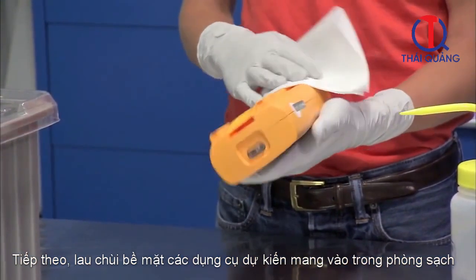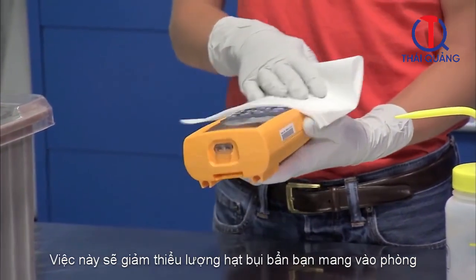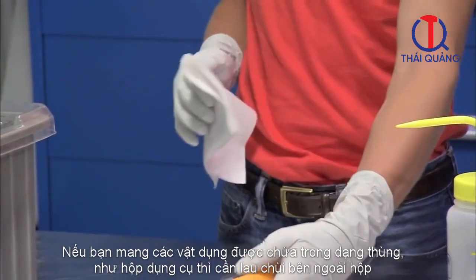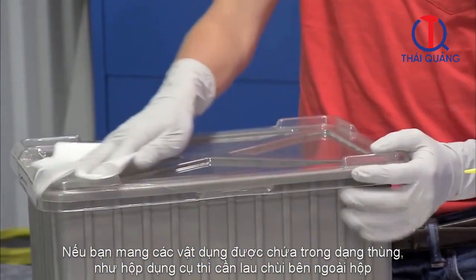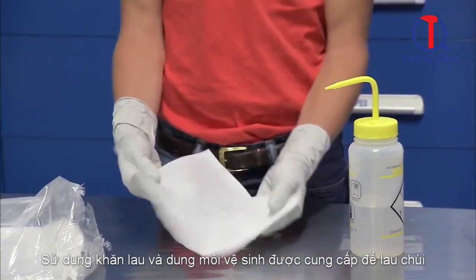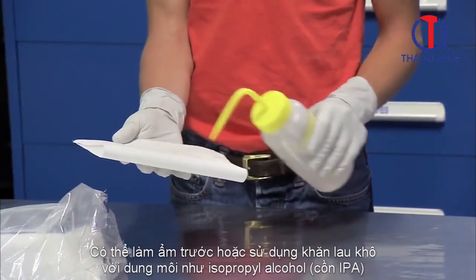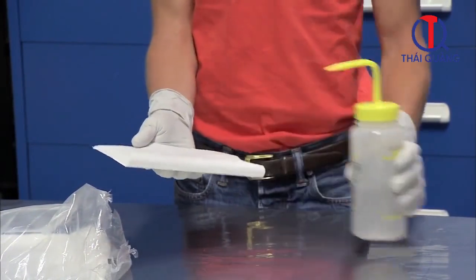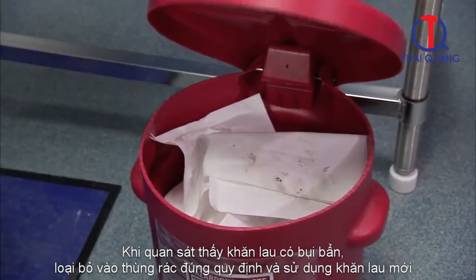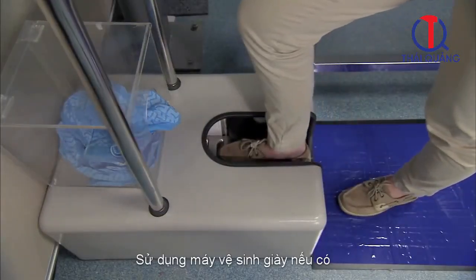Next, wipe down the outer surfaces of any tools and hardware that you plan on bringing into the clean room. This will reduce the amount of particles you introduce to the room. If you are carrying the items in a container, such as a tote, the outer surfaces of the tote must also be wiped down. Use the wipes and solvents provided for your cleanroom area. Wipes may be pre-moistened, or dry wipes with solvents such as isopropyl alcohol may be used. Once a wipe becomes visibly dirty, discard it in the required container and use a new wipe. If shoe cleaners are provided, then use them as demonstrated.